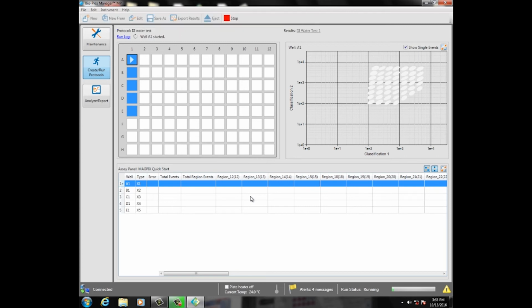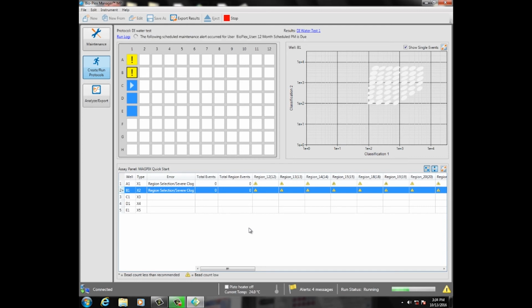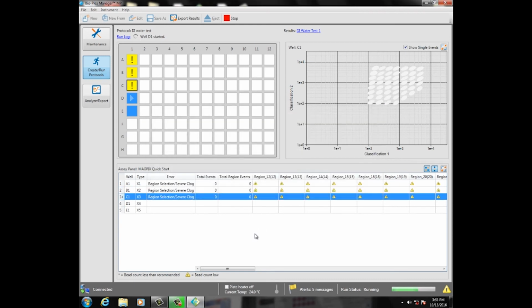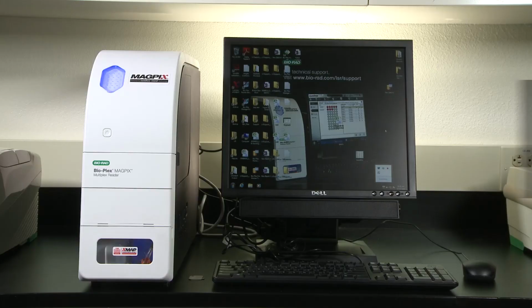Check the bead region plot and bead count in the Classification 1, Classification 2 windows. Don't be alarmed if you get a warning for low bead count. Since no beads were added to the wells, you should see 0 to 2 counts in the wells, preferably 0. If not, this indicates that the flow chamber is contaminated. If that's the case, you will need to perform an extended cleaning procedure to clean the MAGPIX flow chamber.